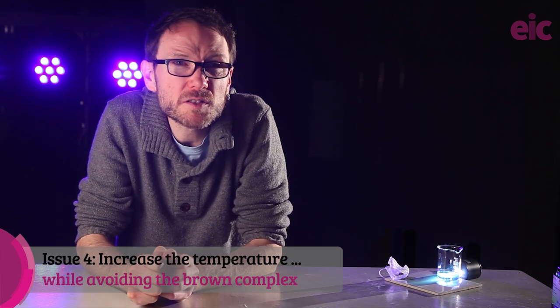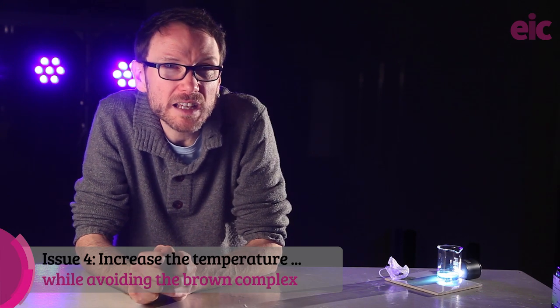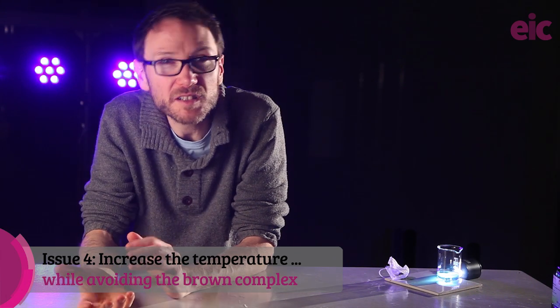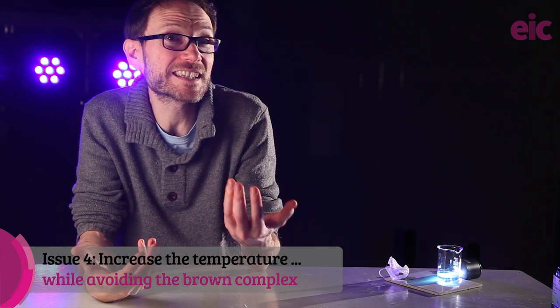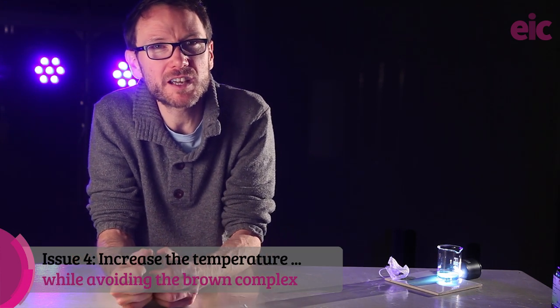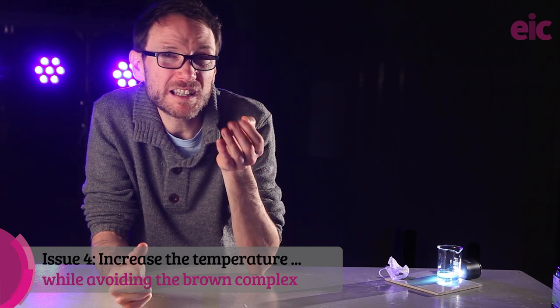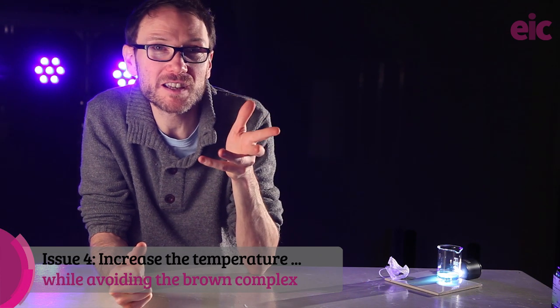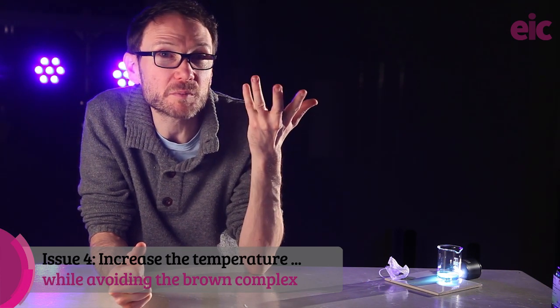I used a 2 mol per decimeter cube solution of hydrochloric acid this time, both acids work. However, the chloride ion can't be reduced by the zinc, and the sulfate ion definitely can. So we're helping our reaction by removing a possible side reaction and starting off with a little bit more acid in the mix rather than losing some of those precious protons in the neutralization of the sodium hydroxide when we're making up the solution in the first place. It reaps some benefits. And now, my fellow humans, we have come to the end of the journey.